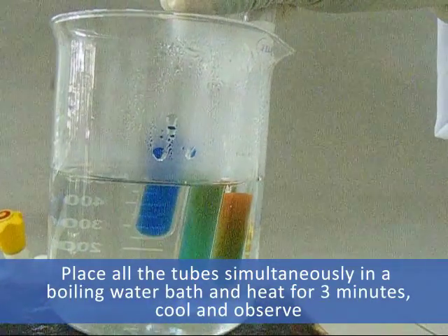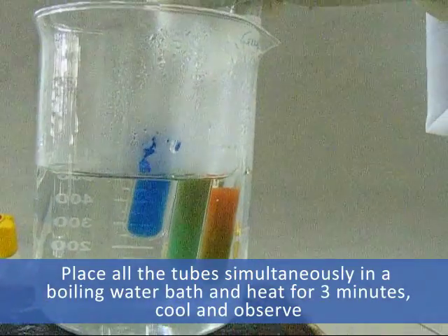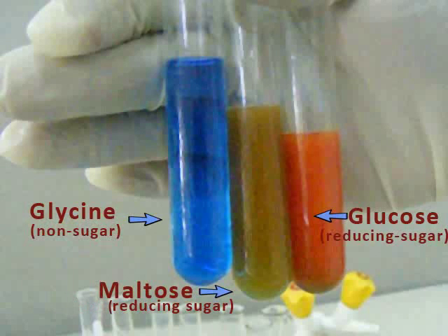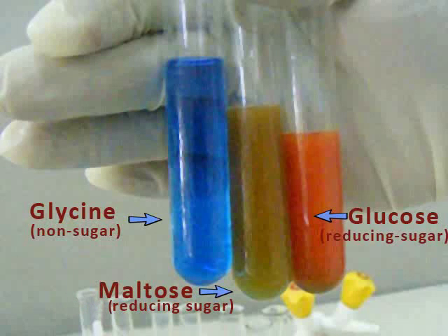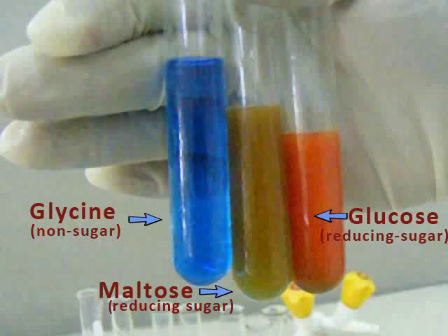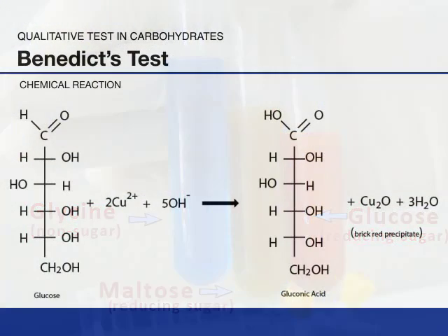Cool and observe. Glucose is a reducing sugar. Maltose is a reducing sugar. Glycine is a non-sugar. On prolonged heating, maltose would hydrolyze into glucose to yield a positive result.